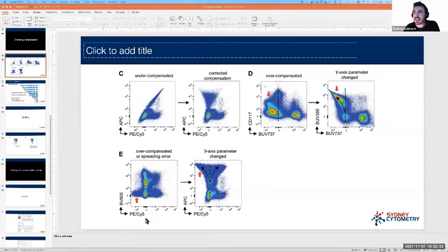Cool. All right, well, we'll press on with some examples. What I've got up here is some data recorded from an X20, and I've pre-set up a few compensation troubleshooting classics, as it were. I'm going to share a preview of what they are. Part of me thinks I should not show the preview and we just work it out on the way, but I do think it's important to have an understanding of what we're trying to tackle. Let's make sure the screen's there. Good.